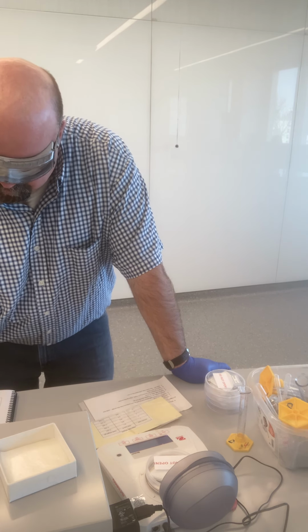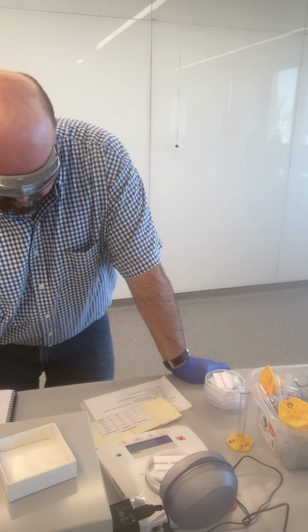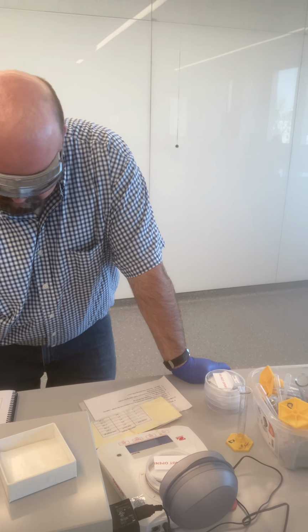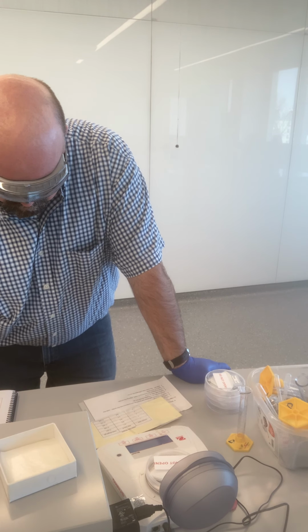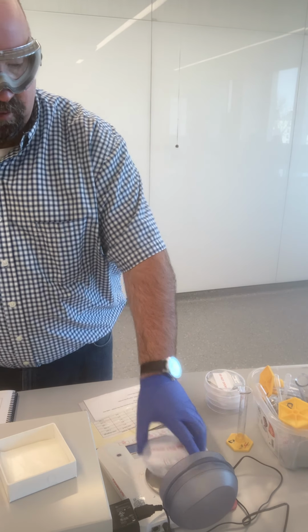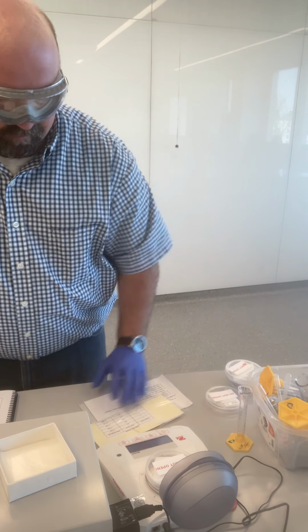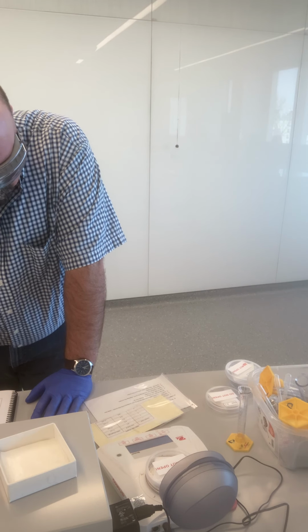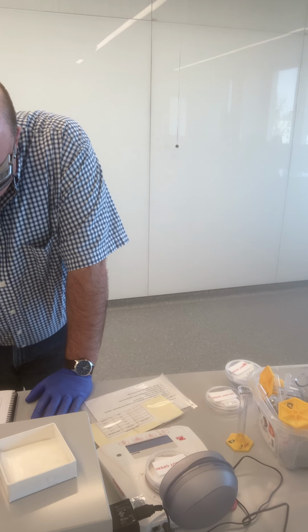I find the mass of sample spot 1 to be 17.527 grams. Again, all that data will be provided for you. Sample spot 2, 17.408 grams.